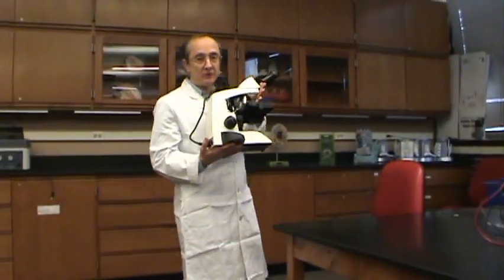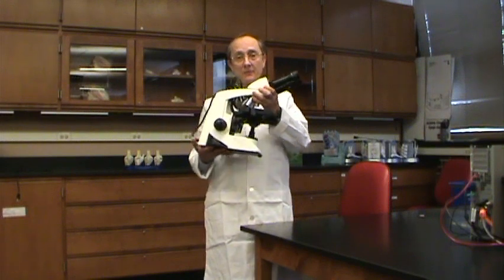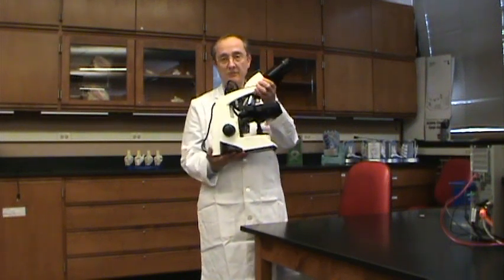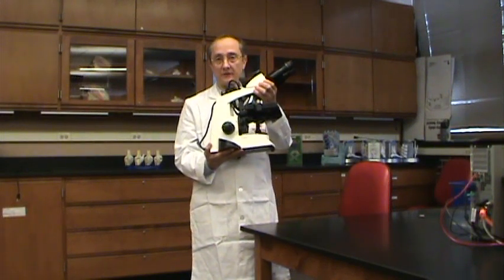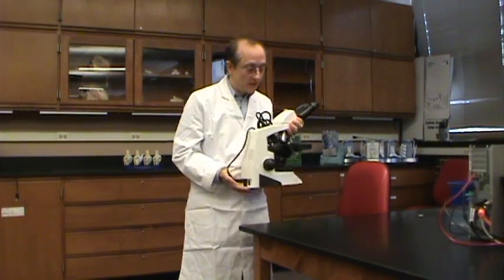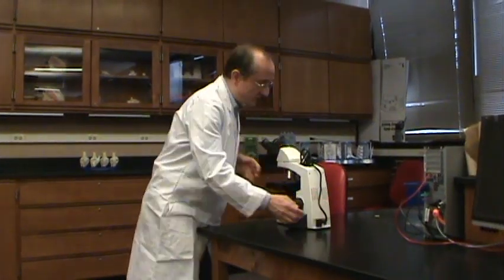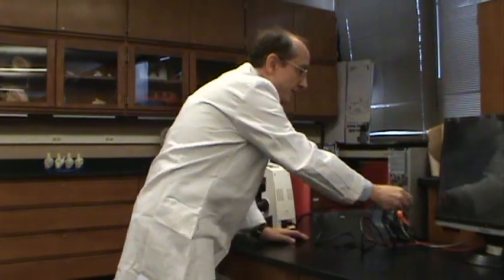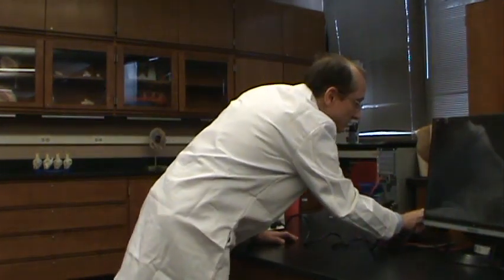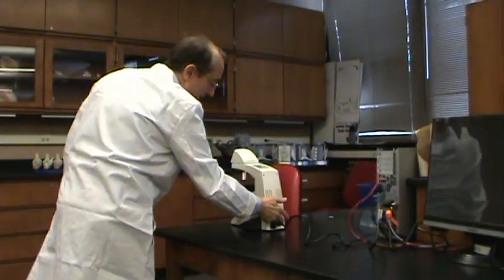So first of all, whenever you're working with a microscope and you take it out of the cabinet, be sure to use two hands — one on the bottom and one on top — and support it. Then once you come to your table, set it down, plug it in, and turn the light on.